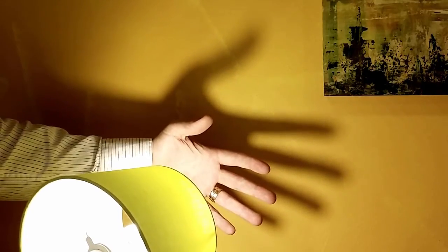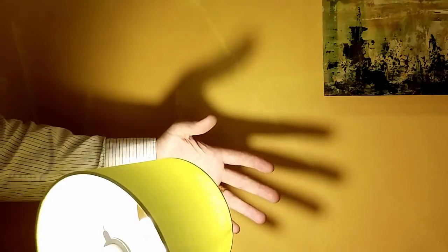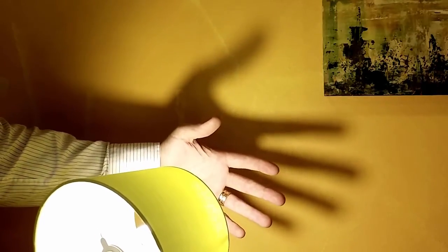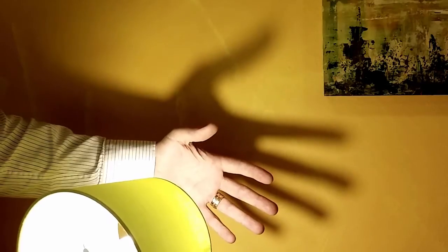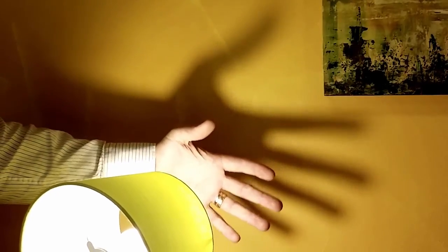If you put in lenses and things, that just makes it a more compact device, but the principle is like this. You can also notice that no light passes through my hand, so we only see the shadow.